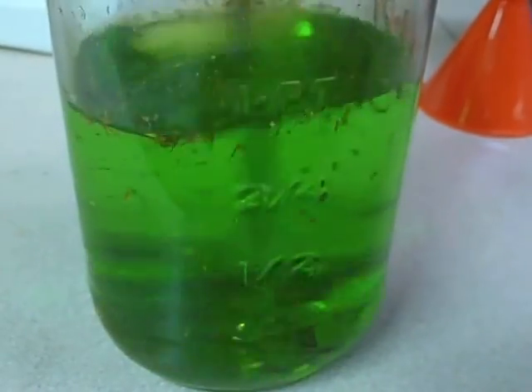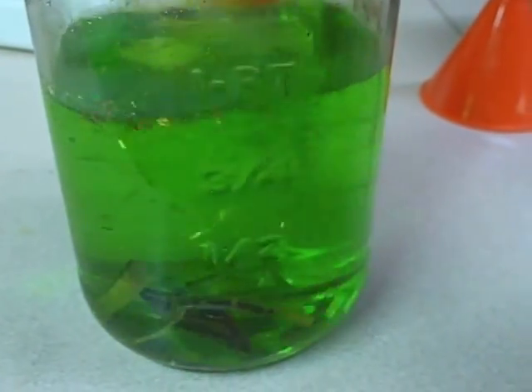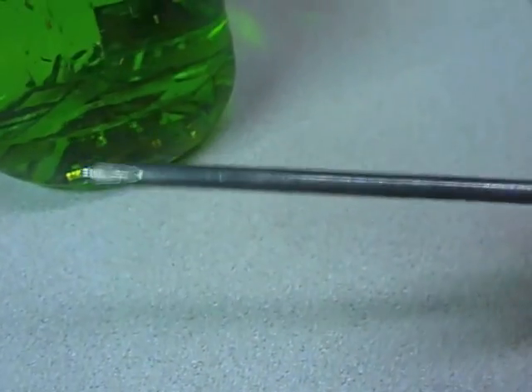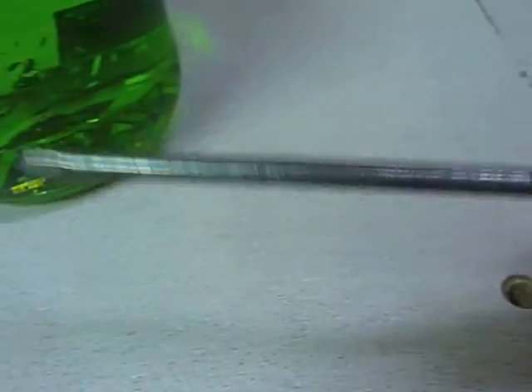You can use the same fluid over and over again for quite a while. I'm just going to use a screwdriver to mix it up. This screwdriver used to be nice and shiny chrome, but you can see what the acid has done to it — so just another warning.